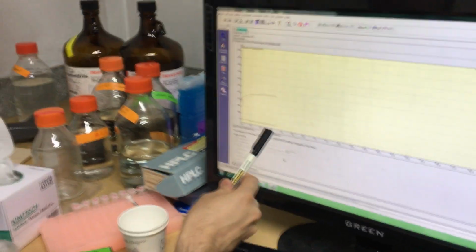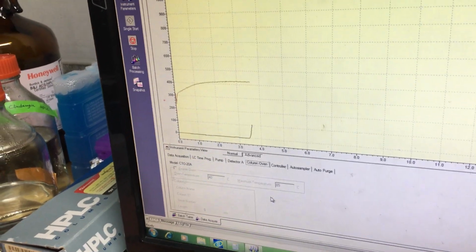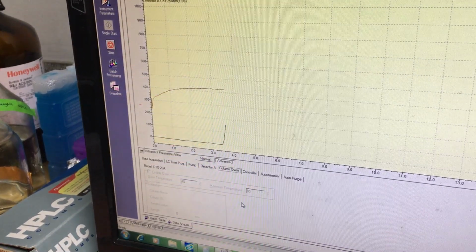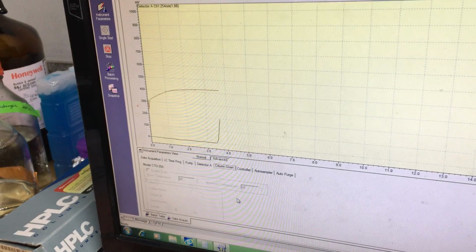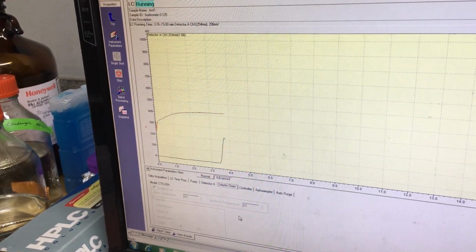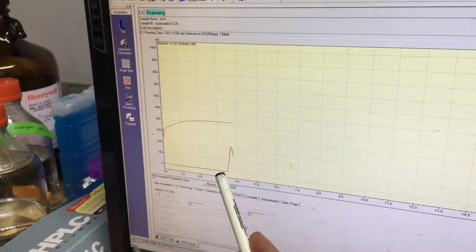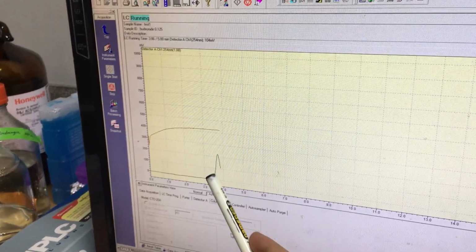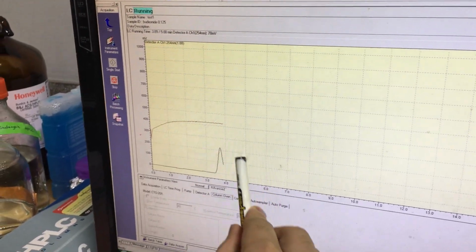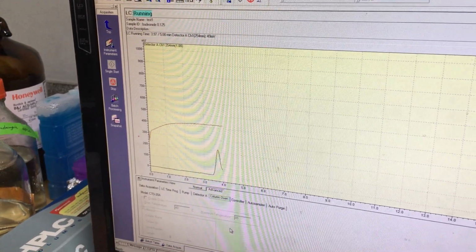Start. So you can see the detection started now. This is called the HPLC peak. This is my standard, only pure budesonide, and I dissolved it in ethanol. You can dissolve in methanol or ethanol. So you can see this is called a sharp peak. If the column is broken, it will look different, but this is a very sharp peak. Later I will show you in the result part.